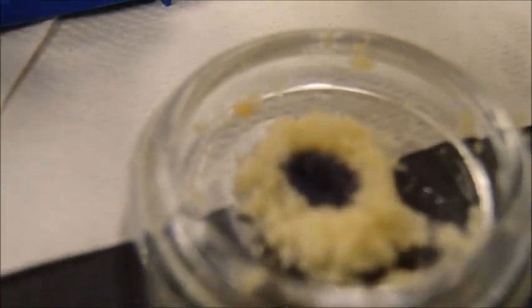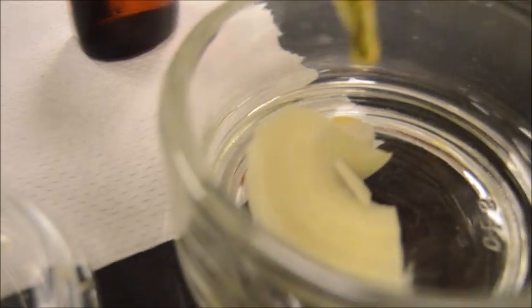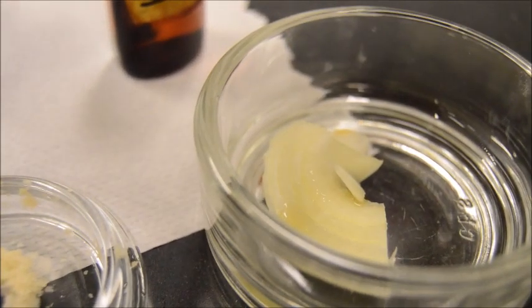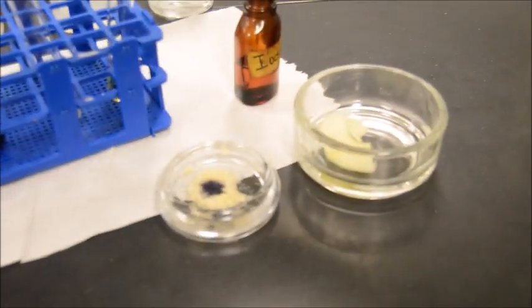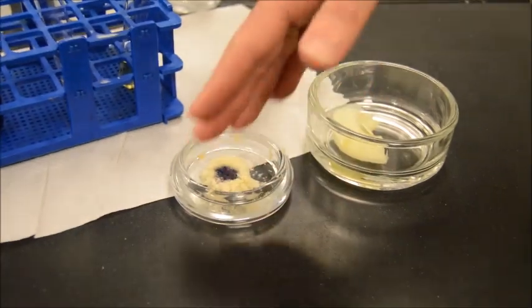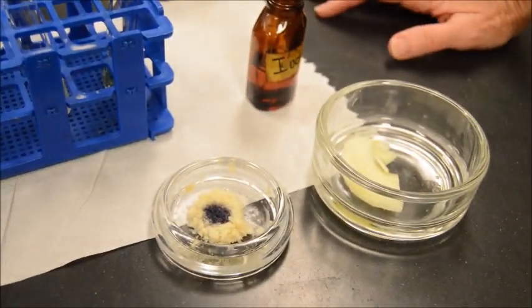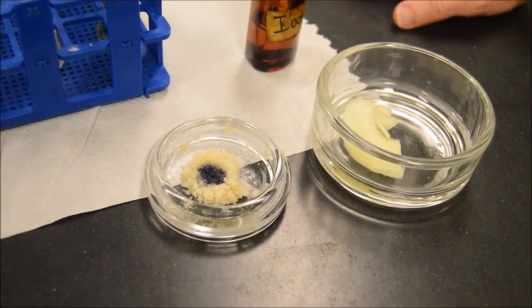You're going to give us another one just for fun? Yeah, a drop or two. Okay, here we go. Wow, complete darkness versus the onion. Wow, virtually nothing. So this shows you that you don't always have to have test tubes. You can use the vegetable itself and do your test, or any solid for that matter, to experiment upon to identify the presence of certain macromolecules.